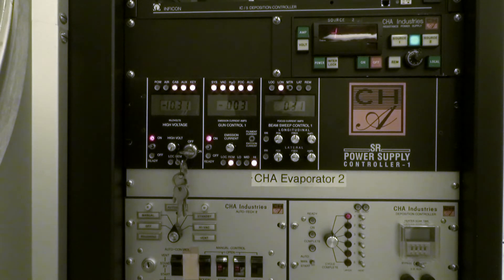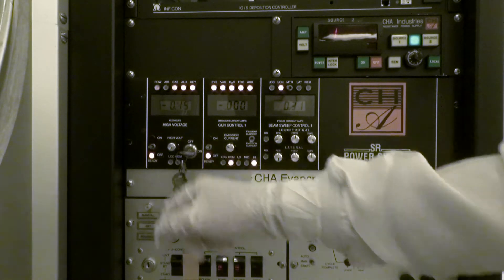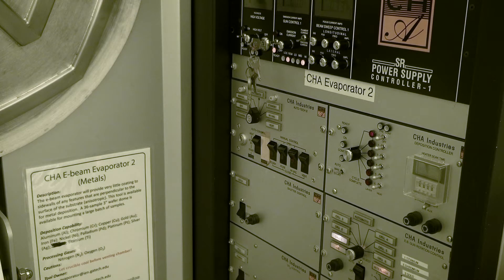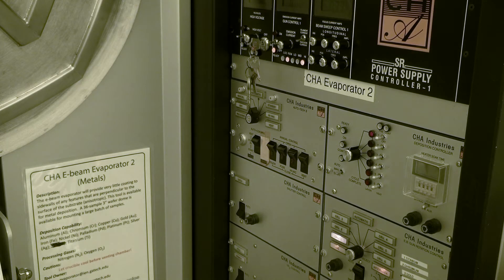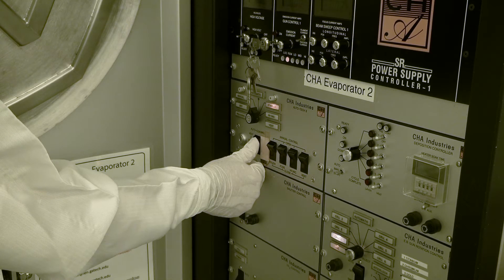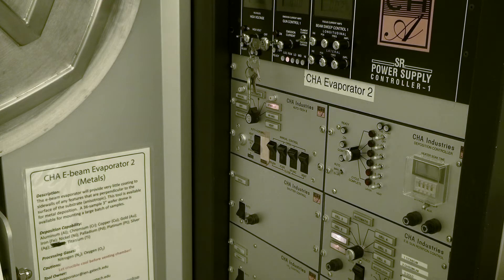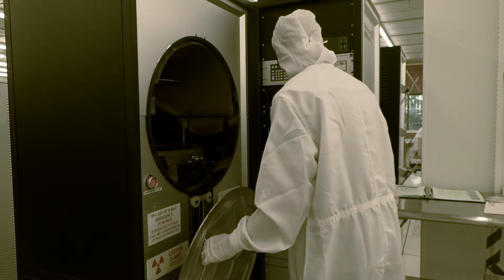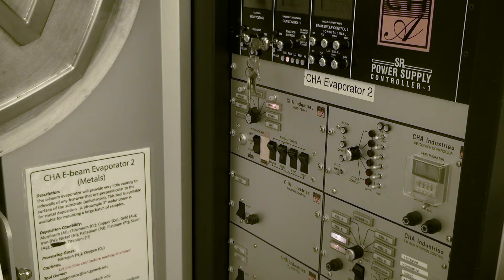To begin unloading your samples, first turn the gun control switch and then the high voltage switch to the off positions on the power supply controller. Then turn the key lock to the off position. Wait approximately 2 minutes for the last crucible to stop glowing. Do not vent the system while the crucible is still hot, as the metal will be destroyed and the crucible could potentially shatter. When the crucible has sufficiently cooled, move the rocker switch on the Autotech 2 controller to standby. Wait approximately 5 seconds for the valve to close, then move the rocker switch to the vent position. It may take a few minutes for the chamber to fully vent. Wait for gauge B to read approximately 7.6×10² Torr, then gently pull the chamber door towards you and slide it down.